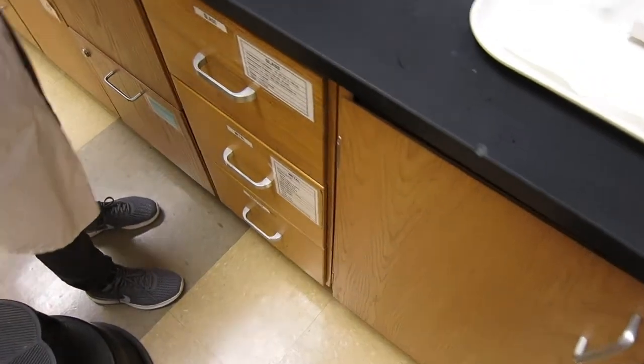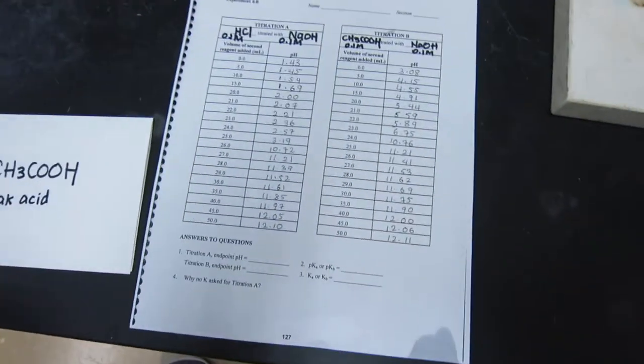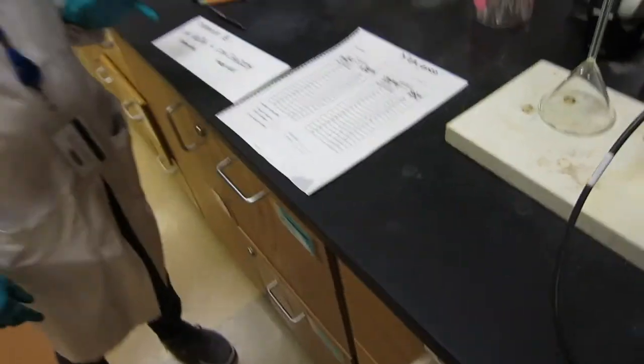This completes our experiment. You can see the titration curve right there.